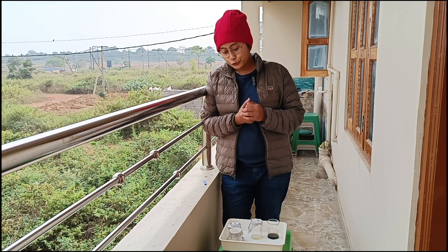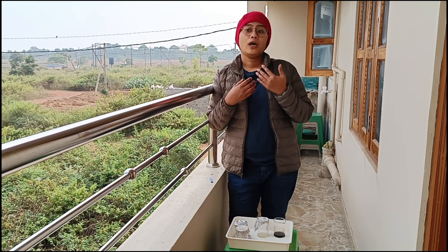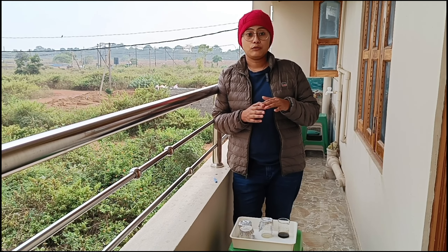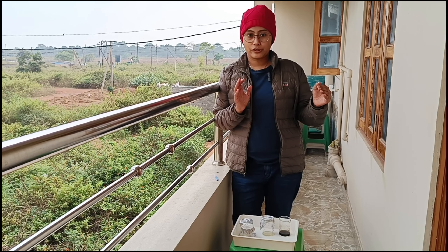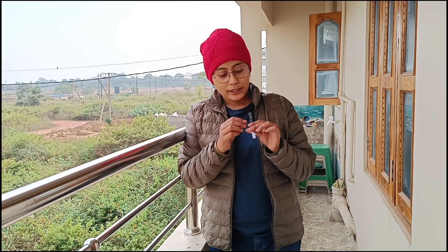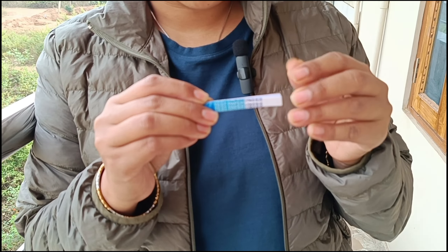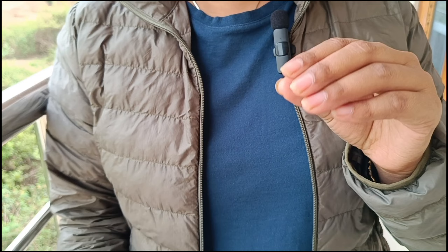We are going to use a shortcut method for testing phenolic compounds without any laboratory test. I'm going to use a blue litmus paper — this is what it looks like. One important thing: some plants possess phenolic compounds and some possess them in very low concentration and some in high concentration.